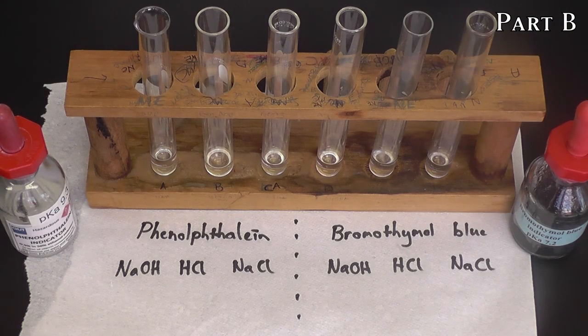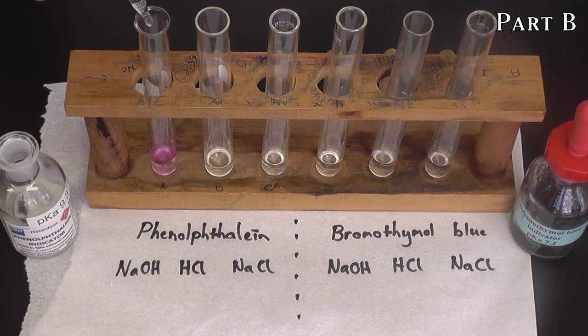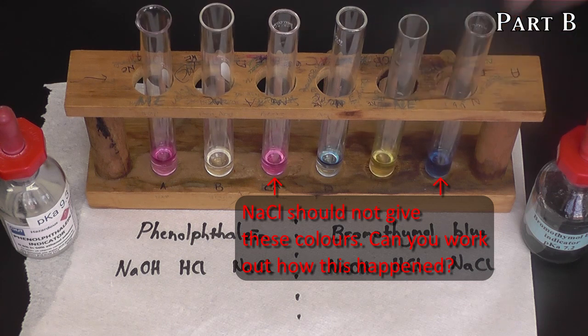In addition to the litmus paper tests, you'll also use some indicators to test whether your solutions are acids or bases. In this case, we use the phenolphthalein indicator and the bromothymol blue indicator. I recommend setting up your test tubes with each of the solutions so you can simply add your indicator one after the next. So by adding a few drops, we should notice a color change quite rapidly, if at all, and record the color change.